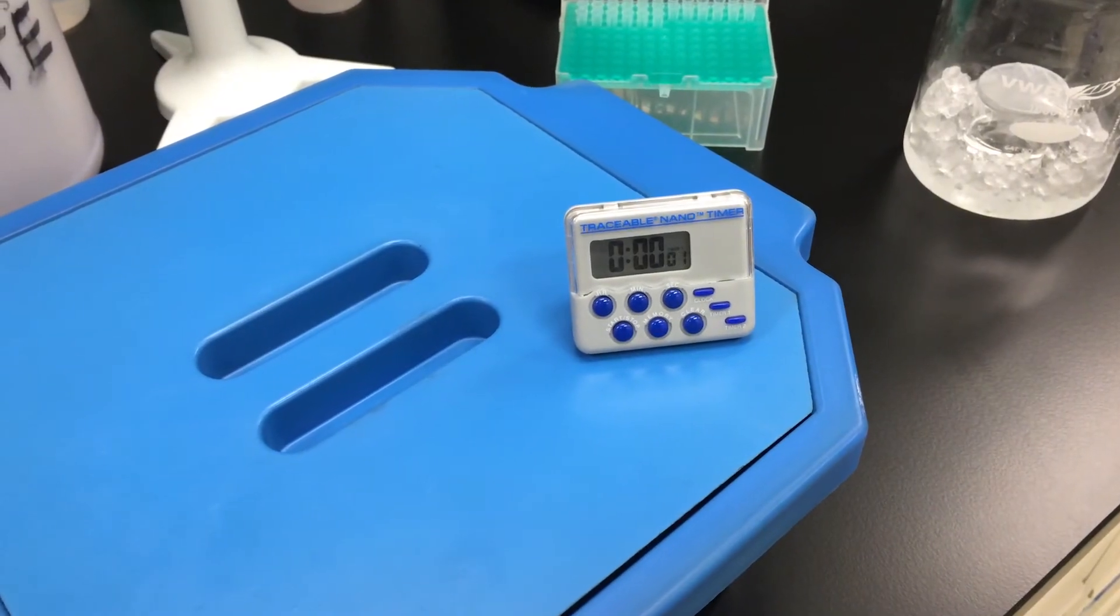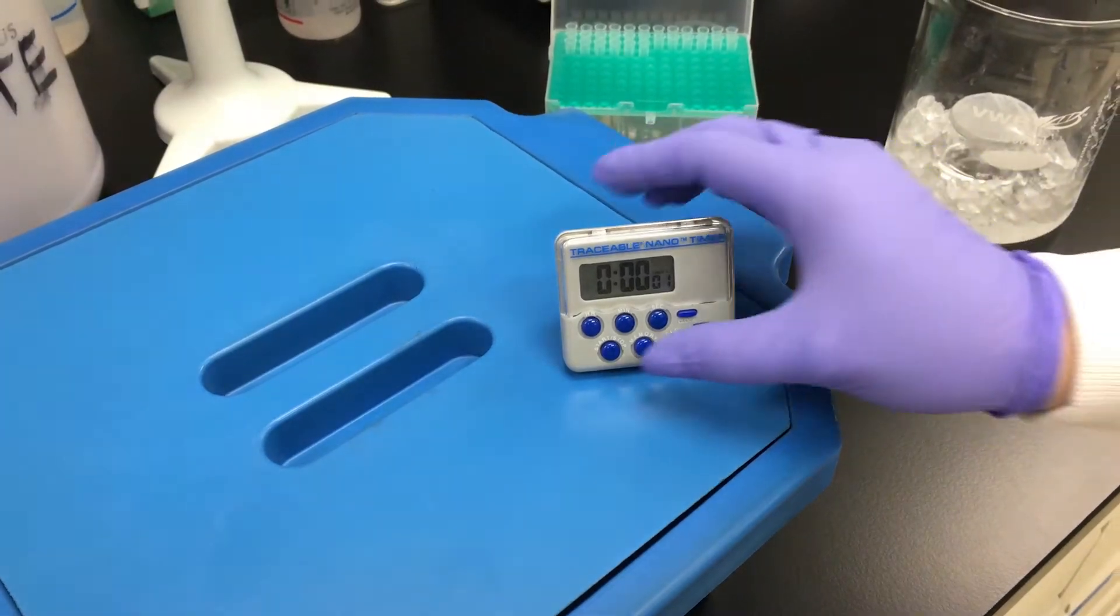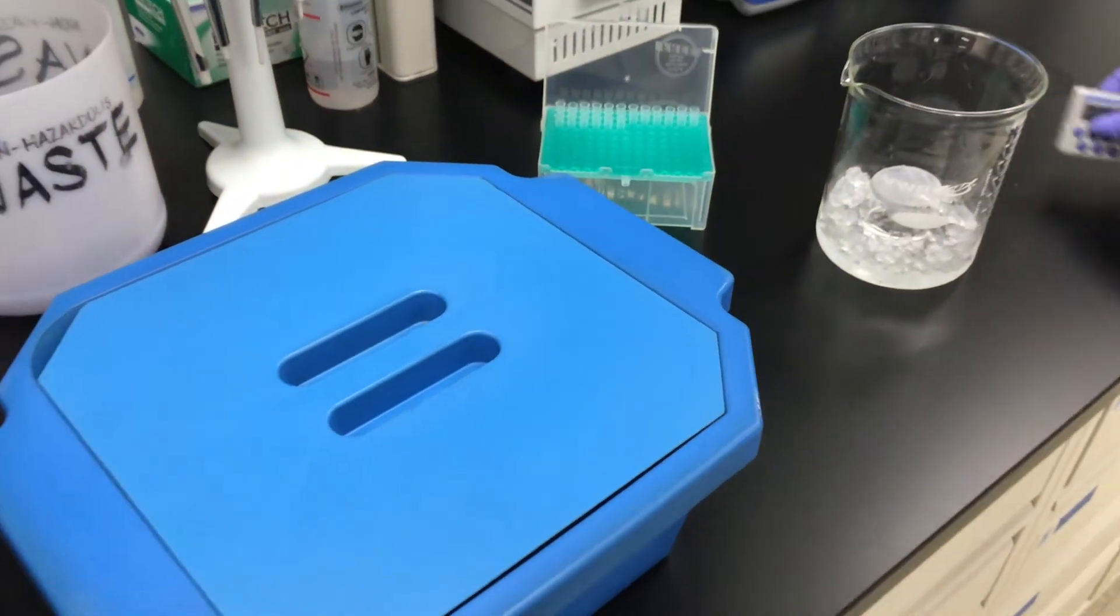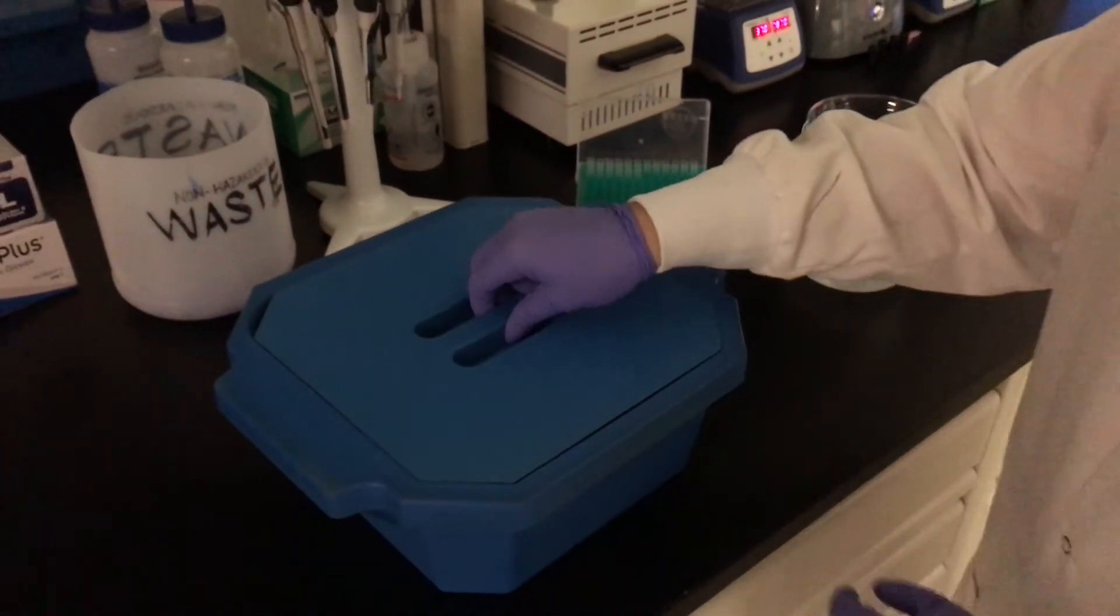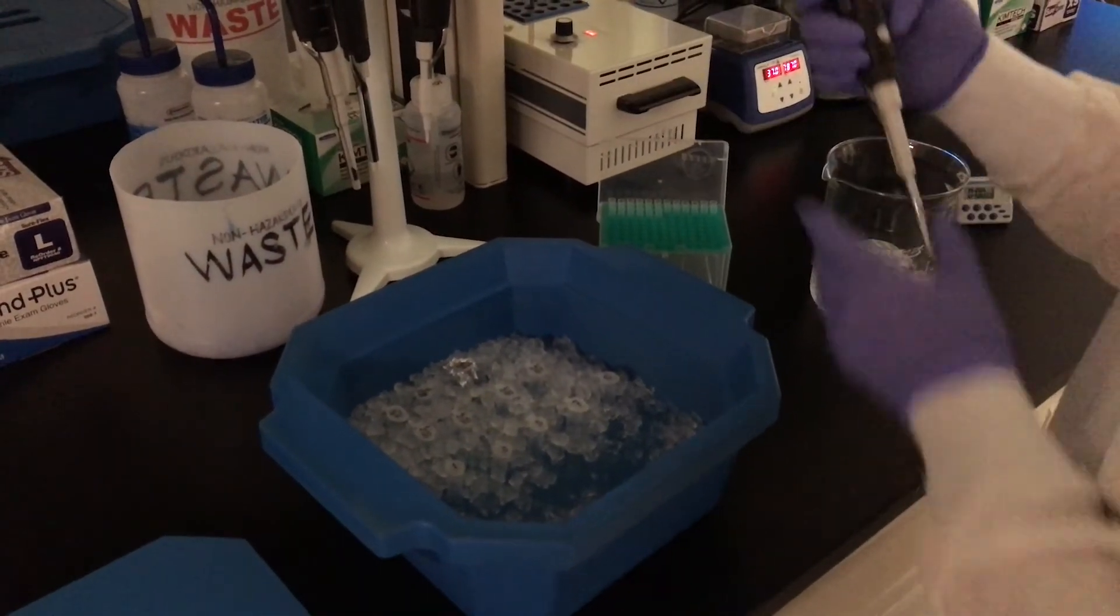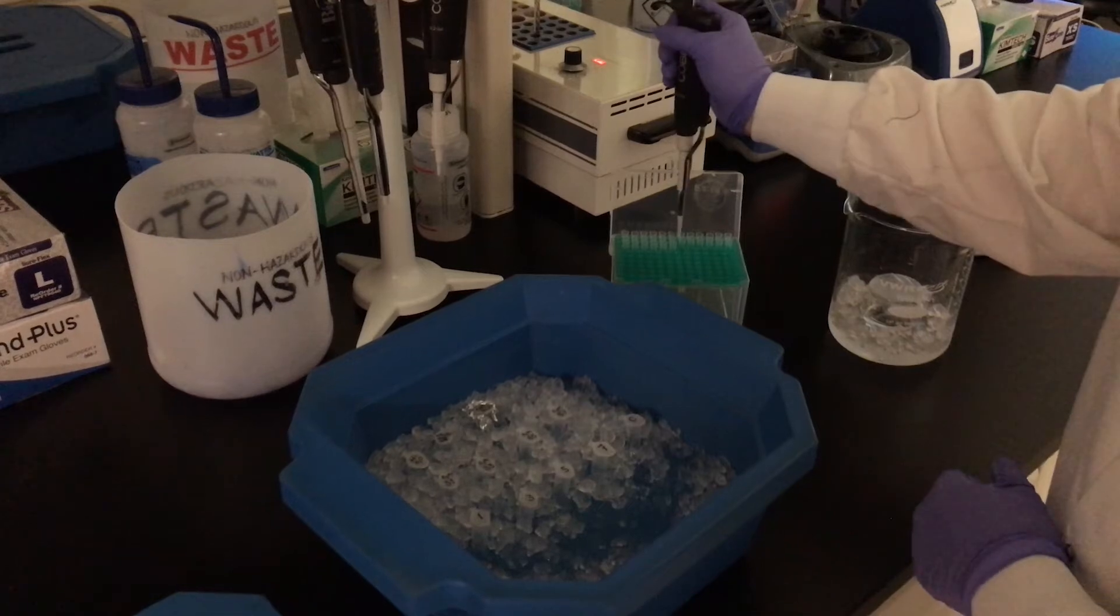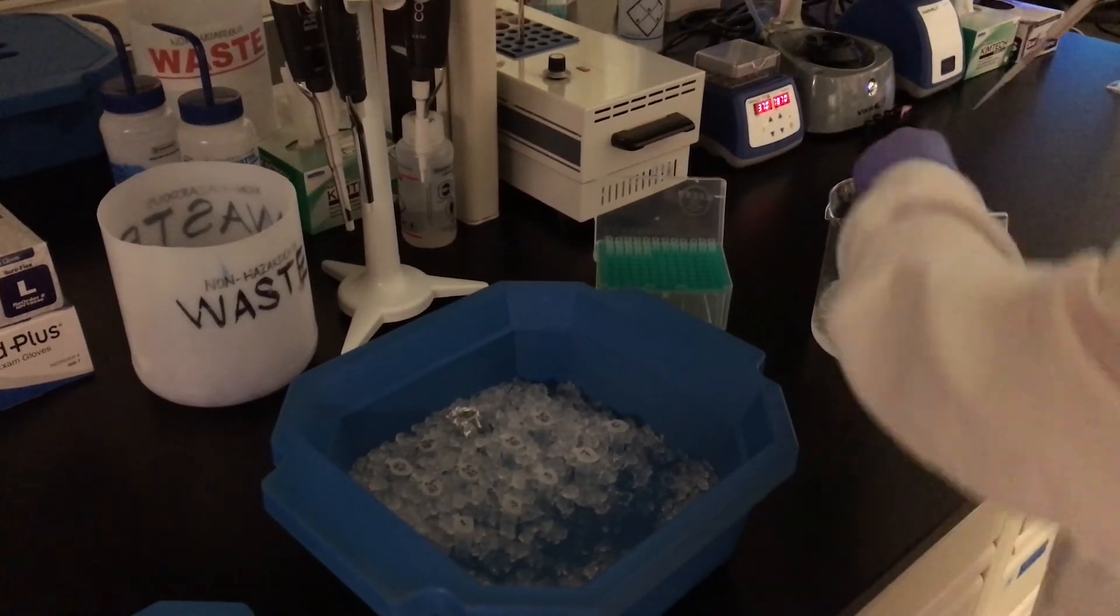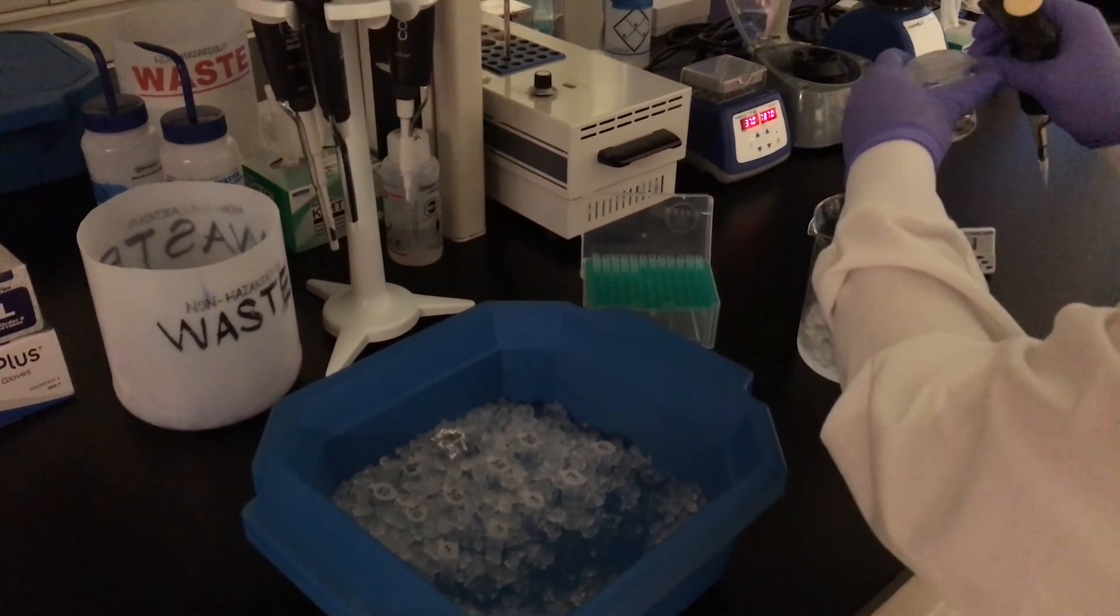Once the 20-minute incubation period has ended, you may lift the lid of the ice bucket, keeping the lights in the lab off. Carefully add sodium borohydride to each solution, ensuring that an equal molar amount of sodium borohydride and silver nitrate are present to ensure that they react fully.